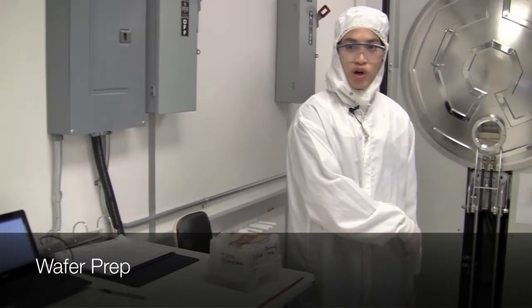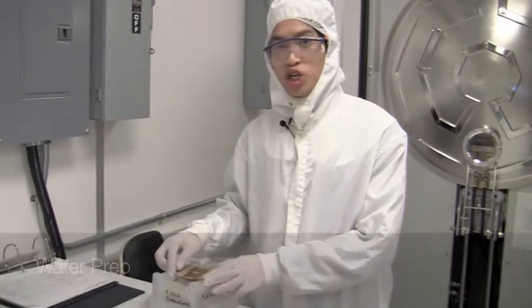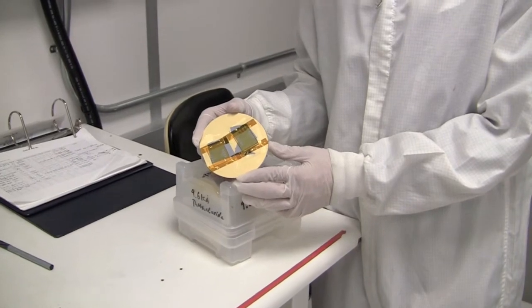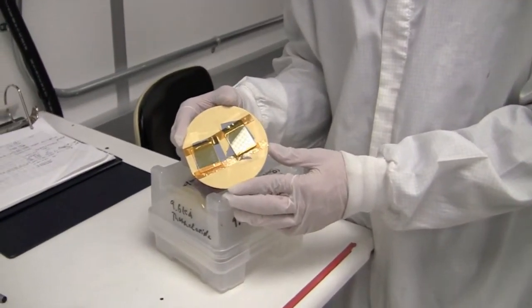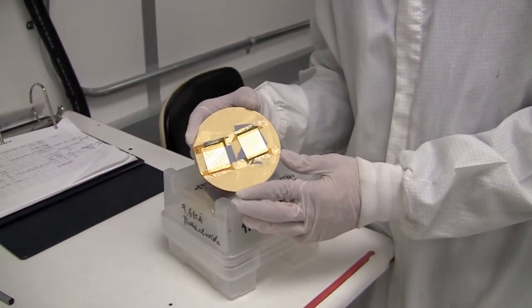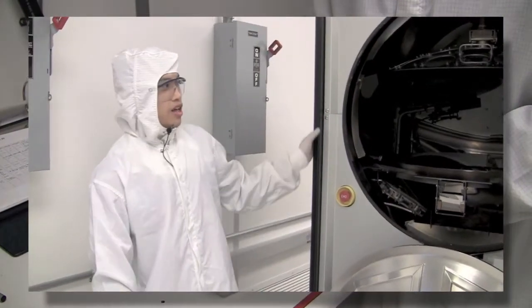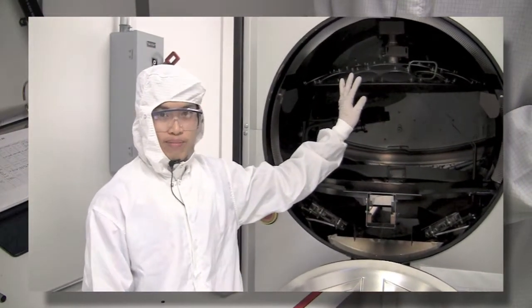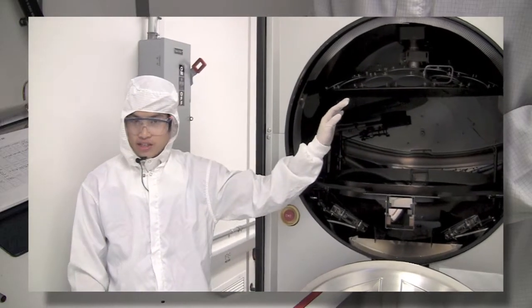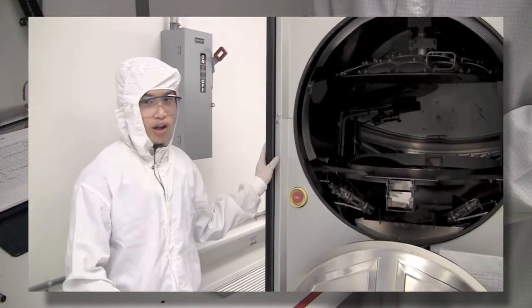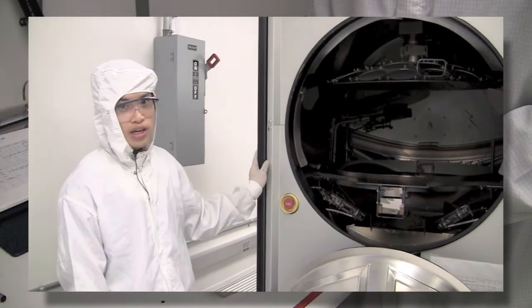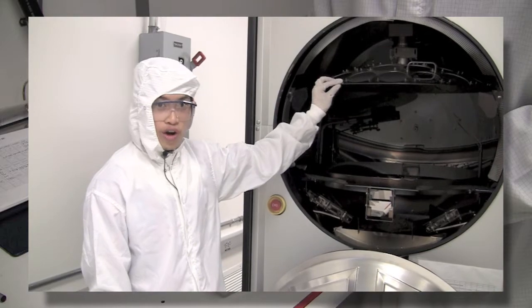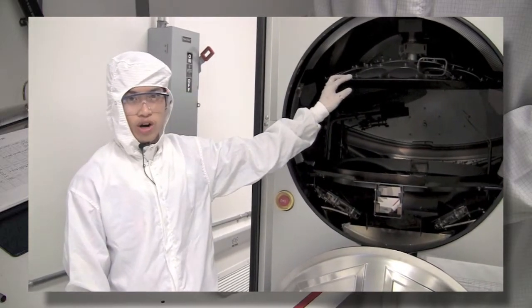Before we open the chamber door to load our samples we want to make sure that all our samples are already mounted onto a wafer and you can see that I did that using the vacuum tape here and that all of our wafers are ready to be loaded. The Mark 50 is capable of loading up to 32 wafers per deposition. If it's necessary for you to load a large amount of wafers it might be a good idea to remove the wafer planetary. If this is necessary for your run please check with staff beforehand.